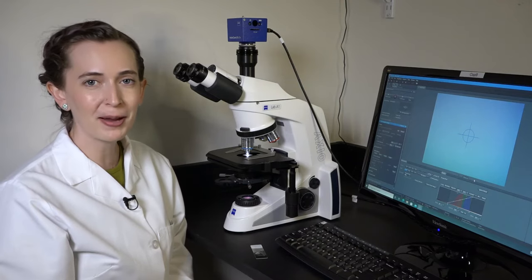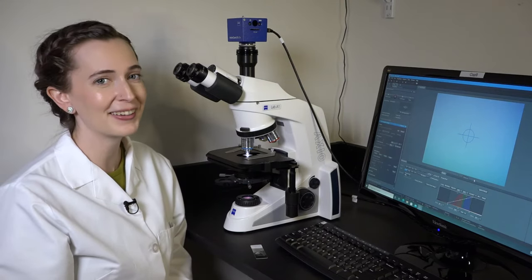You just need a regular old light microscope for this, but I'm using one connected to a computer so we can look at the results together.